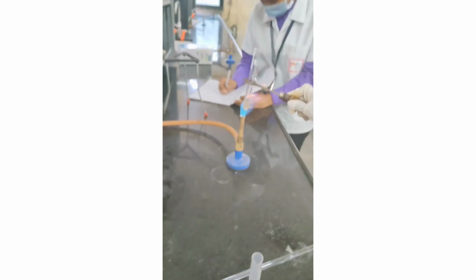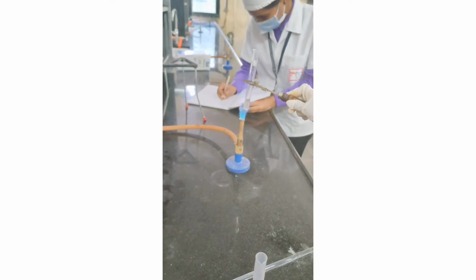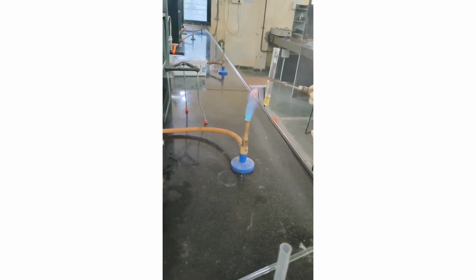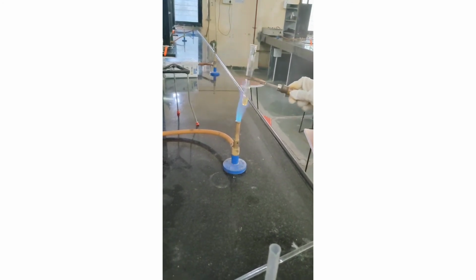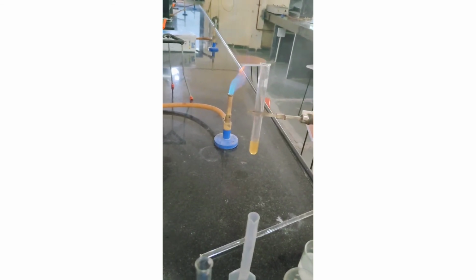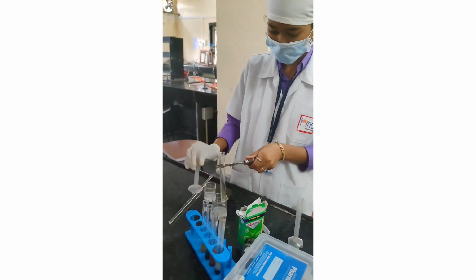If the given carbohydrate is aldose, then the test will be negative, and if the given carbohydrate sample is ketose, then the test will be positive. After 1 minute, the color of the solution remains as it is. It means that the given carbohydrate is not a ketose and it is the aldose. So we have taken the Glucon D sample, which contains glucose, and glucose in chemical structure contains the aldehyde functional group, so it is the aldose. So the Seliwanoff test is negative for the aldose compound and positive for the ketose compound.